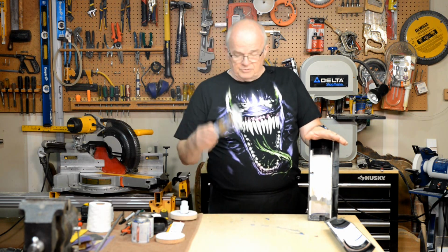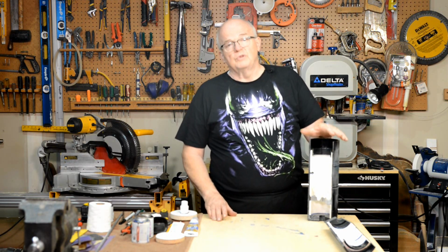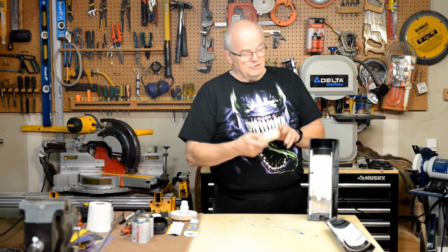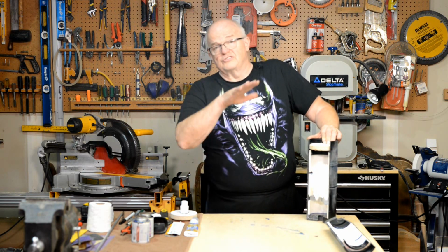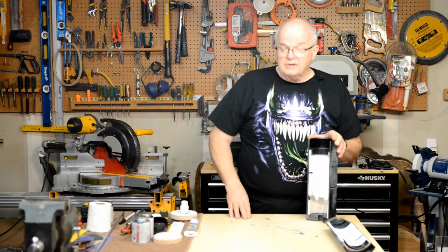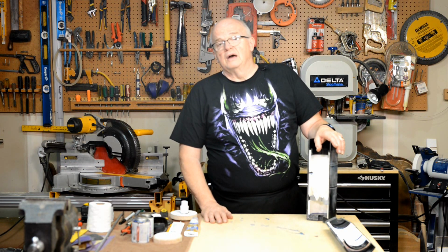Just go ahead and get yourself some silicone, squeeze a bunch of it in there, put your O-ring down inside of it, and even after you put your O-ring inside of it, you can push it down so that the O-ring sits down as far as it needs to go without coming up. So with that, I'm Evan Rowell, and this is Critical Thinking, an update.